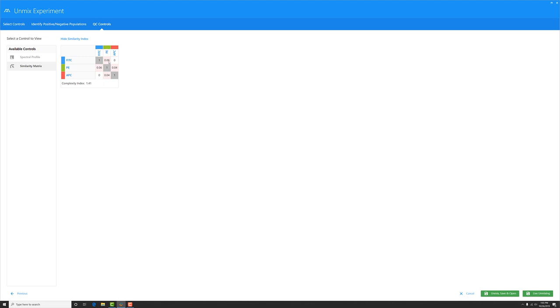So for FITC and PE, they got a similarity index score of 0.06, so they're very dissimilar. And FITC and APC are completely different. They got a score of 0. Then we give you this other number at the bottom called the complexity index. It's a relative number. The lower, the better. Lower numbers mean there's going to be less spread in your panel with the dyes that you've chosen. So keep this number in mind here for this three-color FITC, PE, and APC panel. We got a score of 1.41.